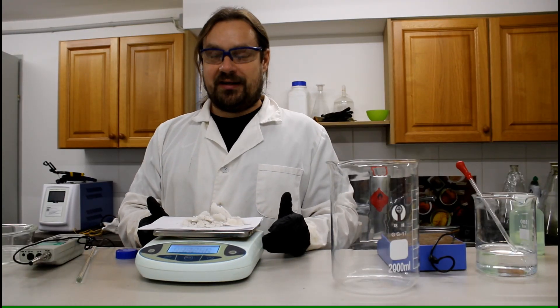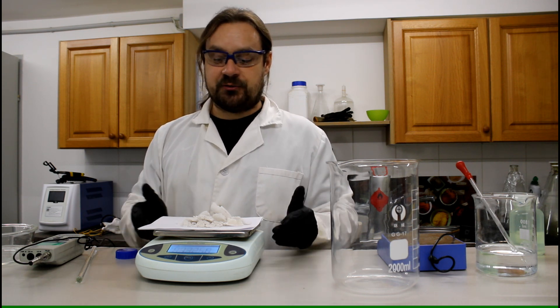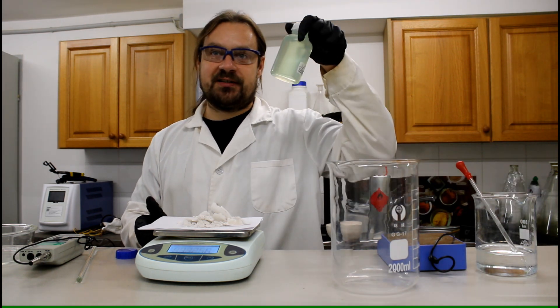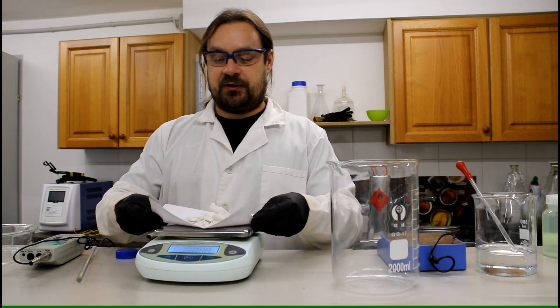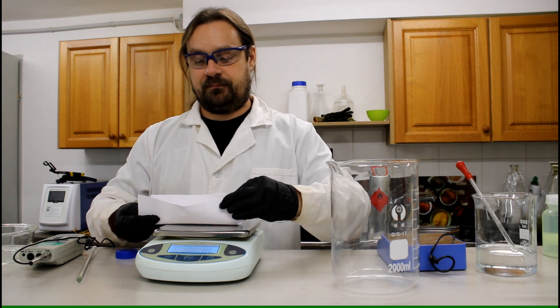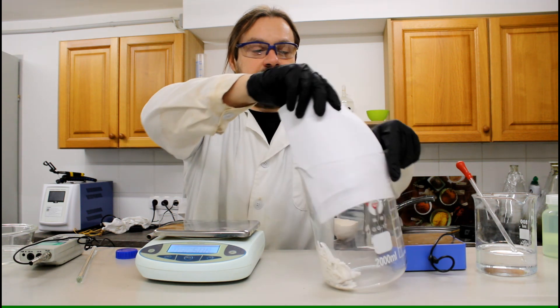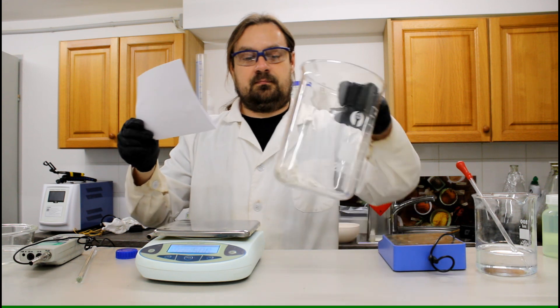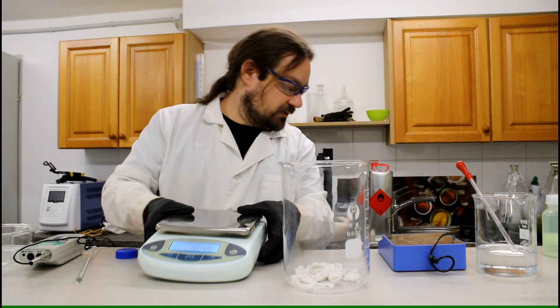So we are left with 132 grams of silver nitrate. According to that value I could later on calculate how much silver is left in the solution. And now we are going to dissolve this silver nitrate in distilled water.